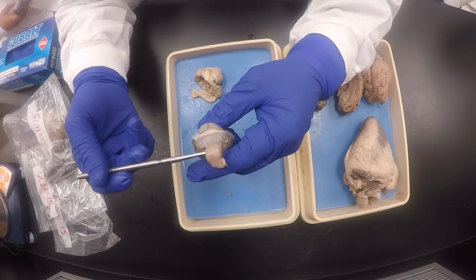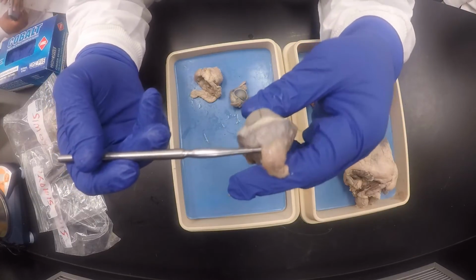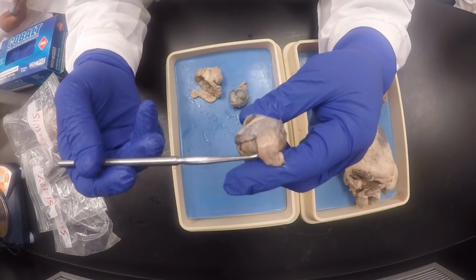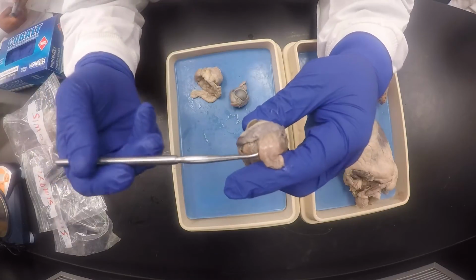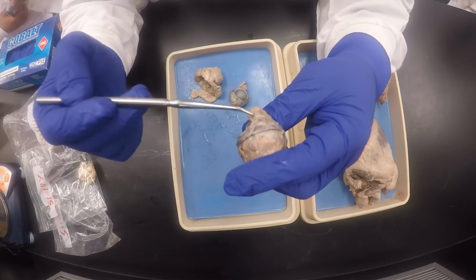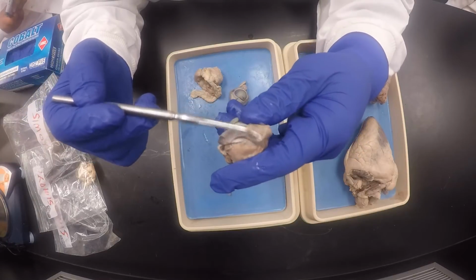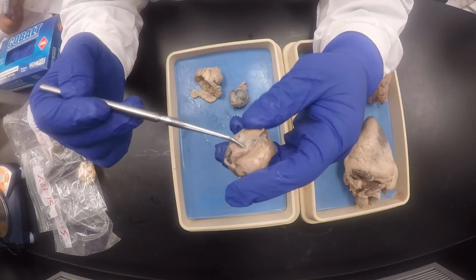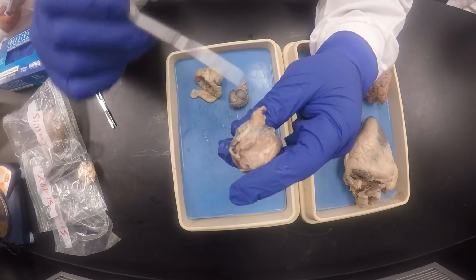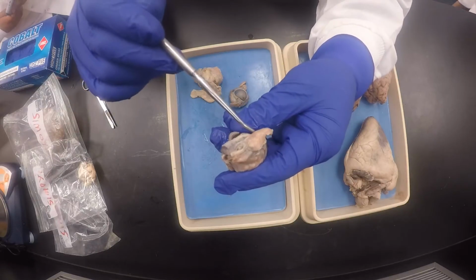To confirm that it is indeed the superior side, you have two muscles, one going straight out, one going at an angle, just like we saw on the lateral side. So there is our superior rectus going straight out. We flip it up like that, and then we are looking, and we are looking, and we are finding, yes, there. The one going at an angle is the superior oblique. So you indeed confirm this is the superior side.